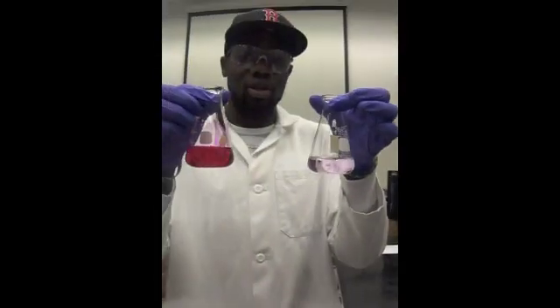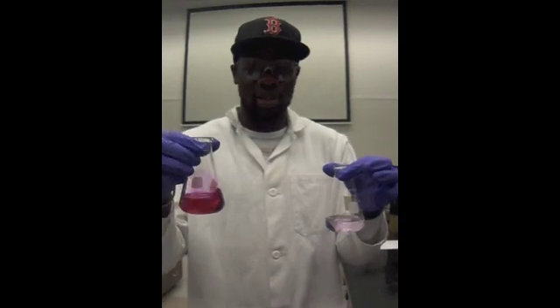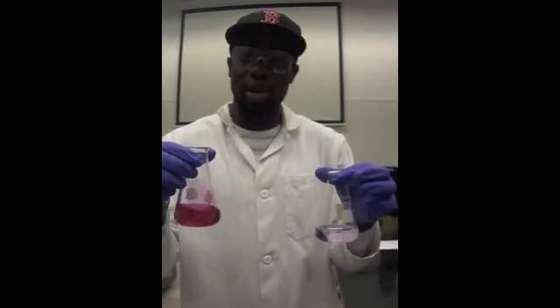Now if you look back at the solution that I showed you before, these colors are not close whatsoever. The reason this color turned such a dark pink is because you added too much sodium hydroxide.